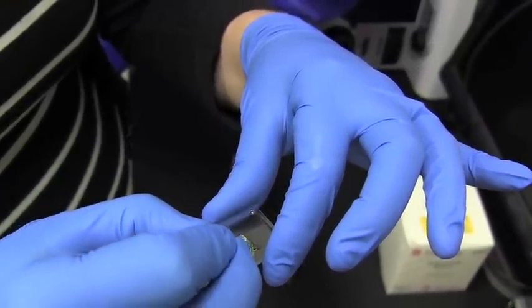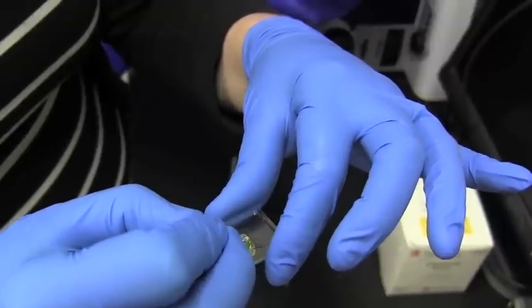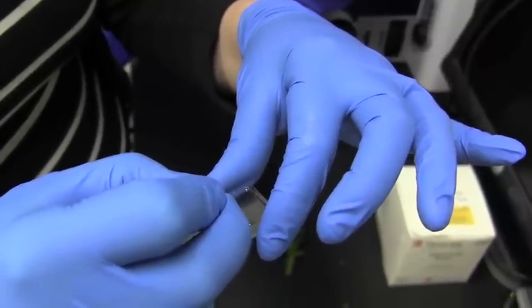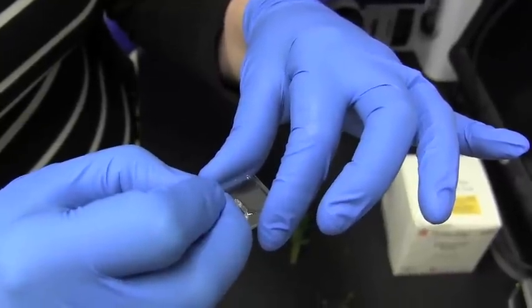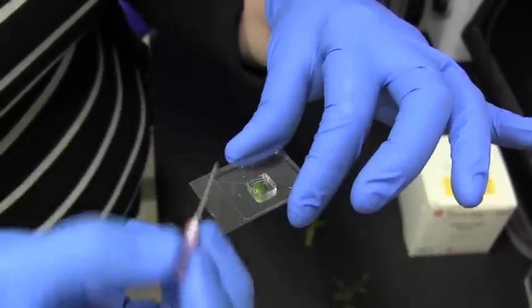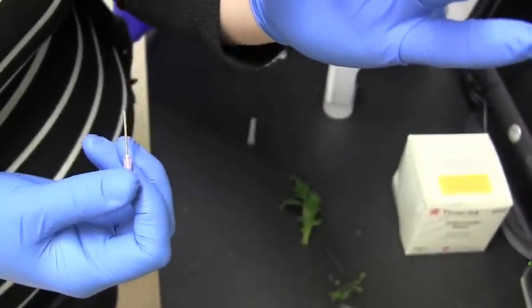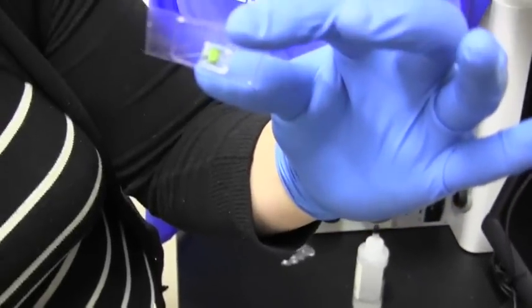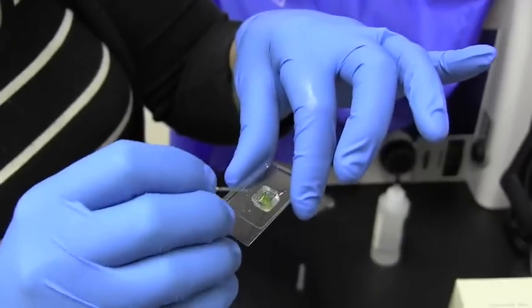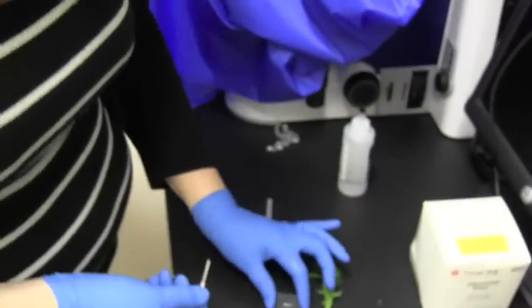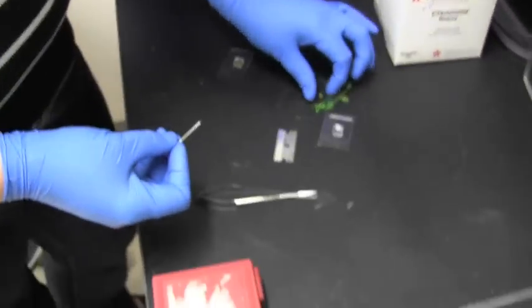Now this part is really tricky because when you put one in, the other one moves. You can see they're kind of flush with the bottom, and they're ready to freeze.